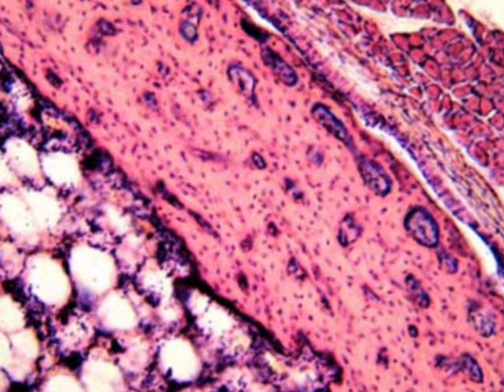If you have a label for these small dots here, these are the osteocytes present in their lacunae, or osteocytes in lacunae. So in this area we don't have anything except these Haversian blood vessels.